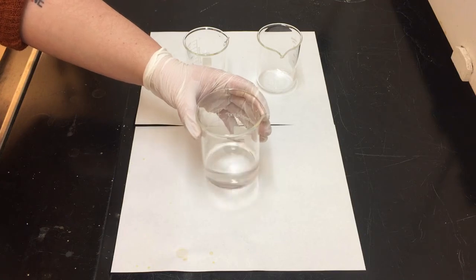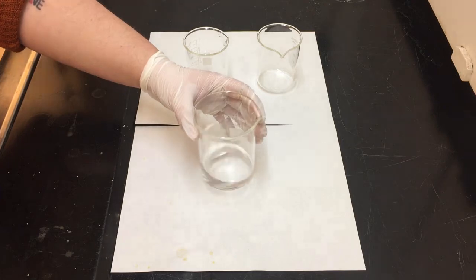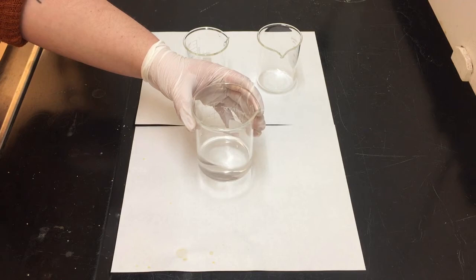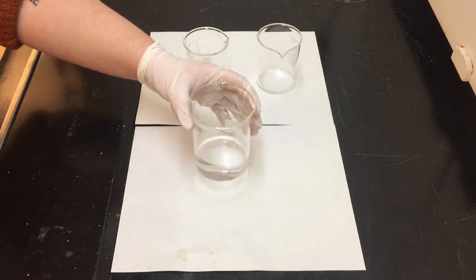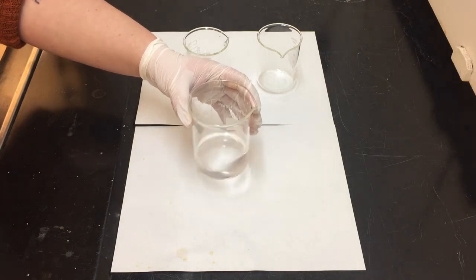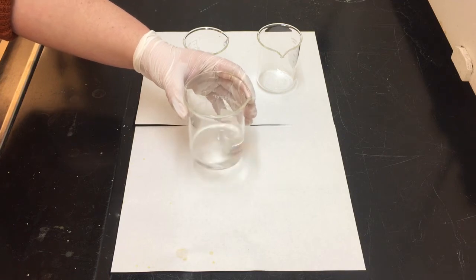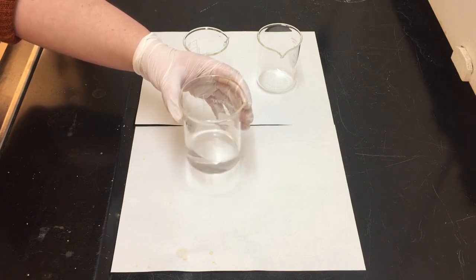We do not see, at least with our eyes, any generation of that blue product yet, since equation 3 is competitively interacting against equation 2, and currently equation 2 is winning. But once all of the S2O3 2- gets eaten up, equation 3 is going to take over very quickly, and we are going to see a rapid generation of blue product. So while we wait, enjoy some of the music, and let's get a timestamp once the blue product is starting to form.